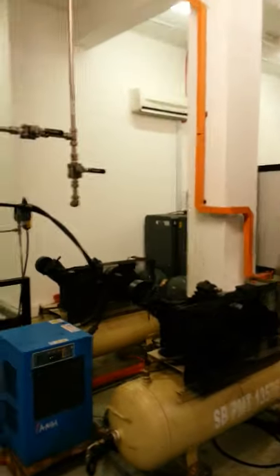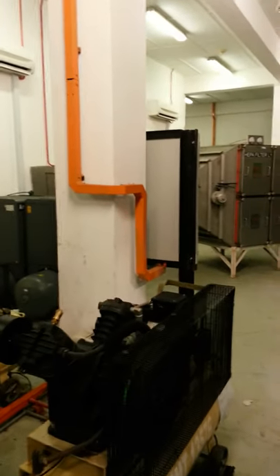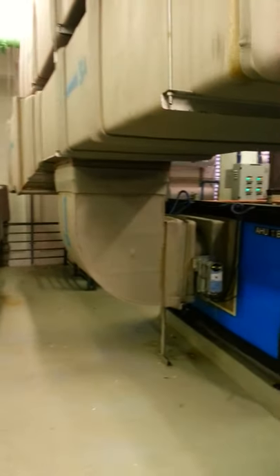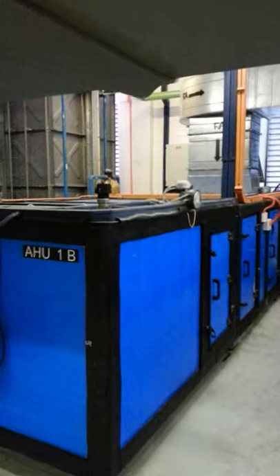There are compressors here and these compressors are responsible for maintaining the pressure of the water and the air which is supplied to this facility. Each of the rooms or units located in the floor below is connected to its own individual HEPA filter.